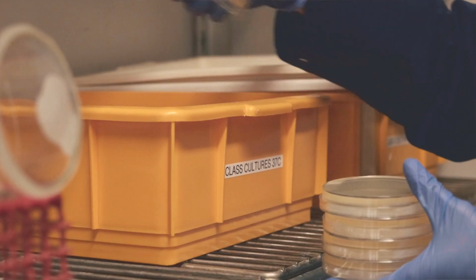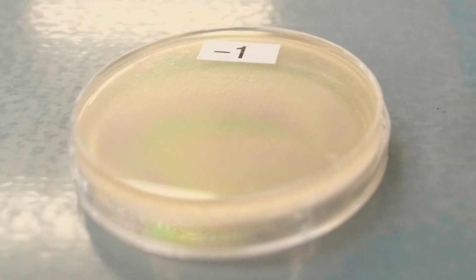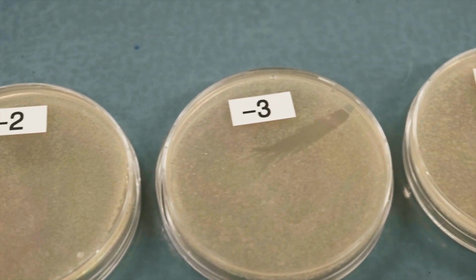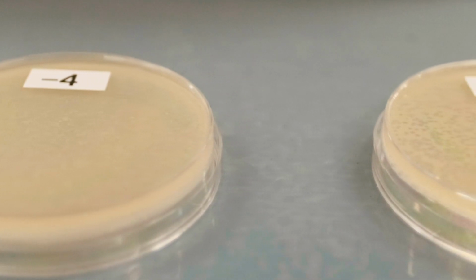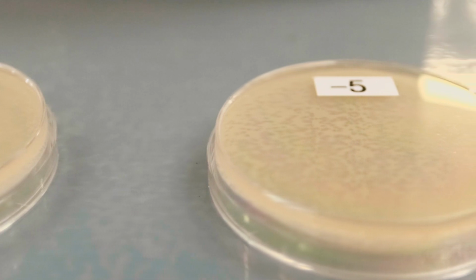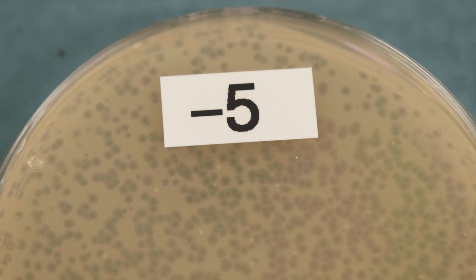After incubation at 37 degrees Celsius, you can see the plaque-forming units, or PFUs, present on the plates, representing where phage have infected and lysed the bacterial host cells. This is an indirect measure of phage activity, but you can visualize the change in PFUs throughout the series of phage dilutions.